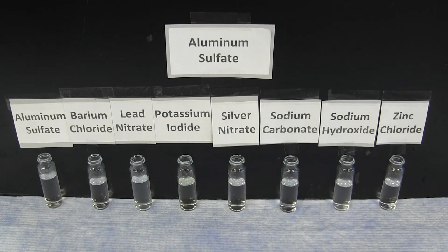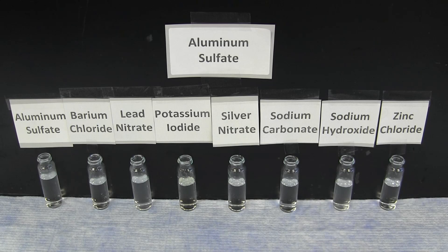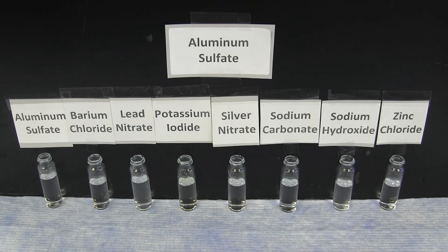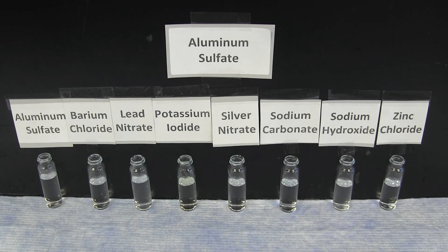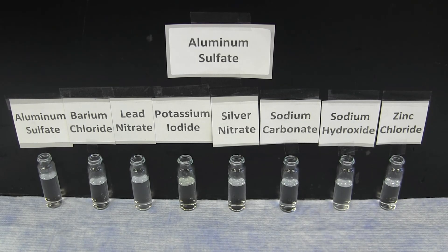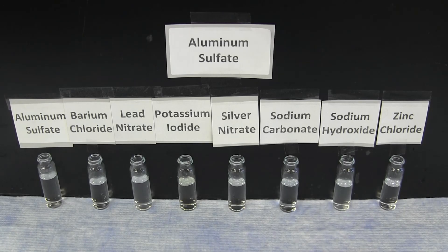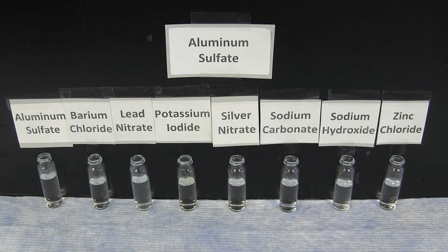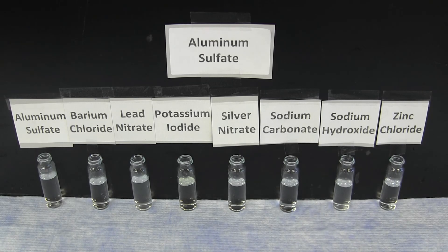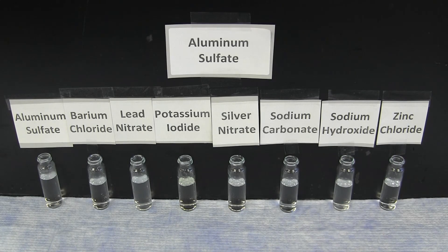This video experiment looks at the reactions of eight different solutions in each of their combinations. The eight different solutions are aluminum sulfate, barium chloride, lead nitrate, potassium iodide, silver nitrate, sodium carbonate, sodium hydroxide, and zinc chloride.